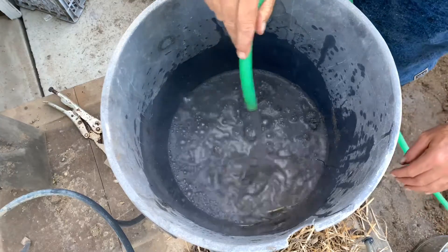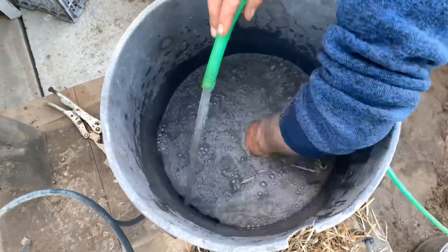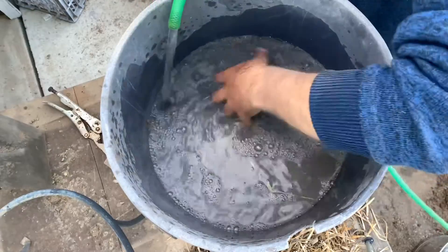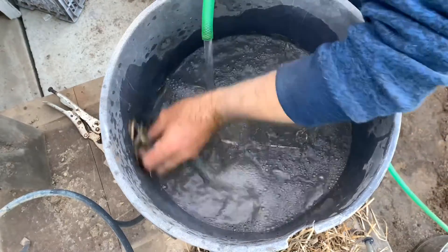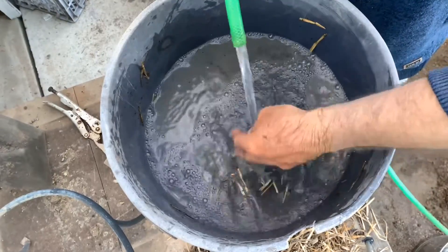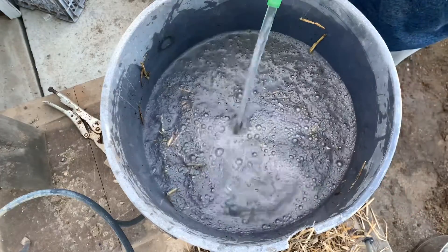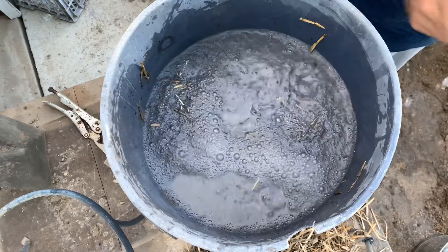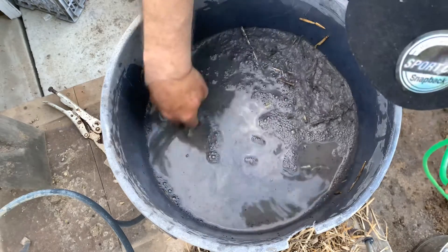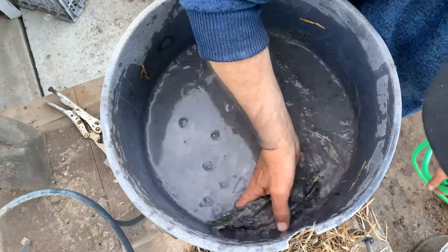As you're doing it, you can actually see it clearing at the edge. That should be heaps. You can see a bit of the charcoal settle into the surface — that can all come out.